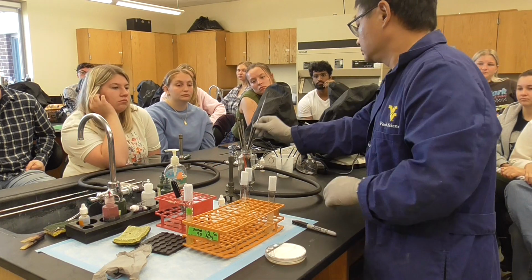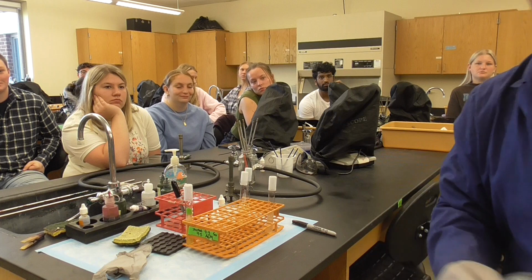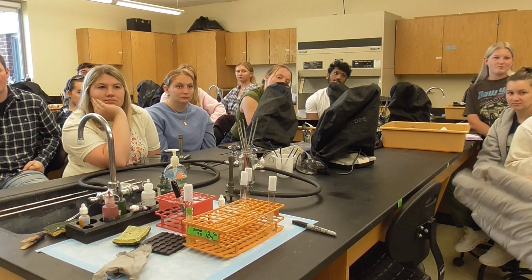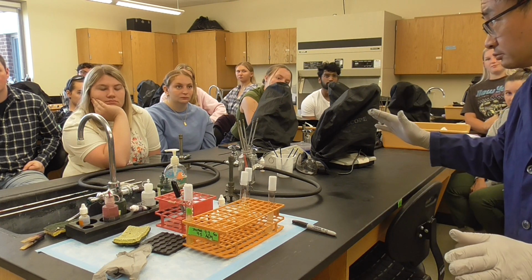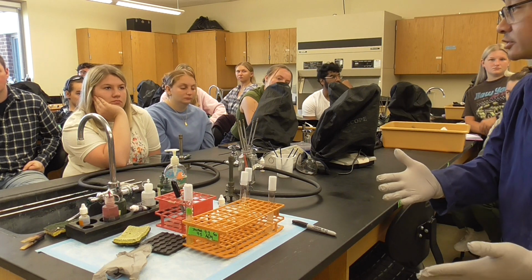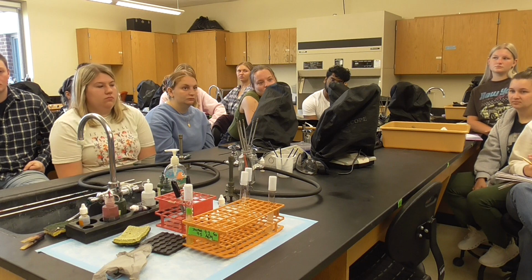Okay, now make sure you turn it off. I will keep my plates, because I know some people won't do very well. Then I can lend my plates to them. Okay, so I keep my plates here. And also, when you finish everything, make sure, in good order, you give it to the TA. Otherwise, it's going to be a complete mess on Thursday. I think he will arrange a rack for broths, a rack for slants, and another special one for agar plates. It is simple, but you have to do it in a civil way. What I mean by a civil way is organized, gentle and organized.